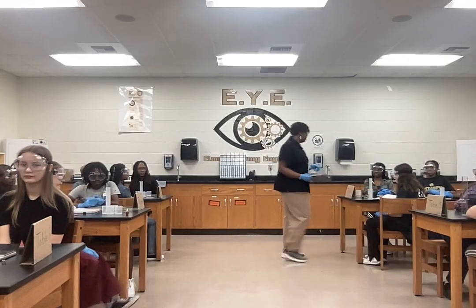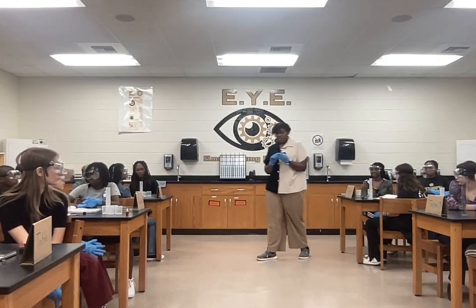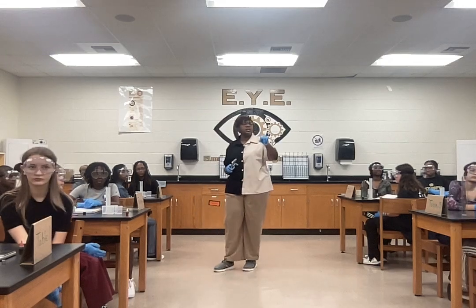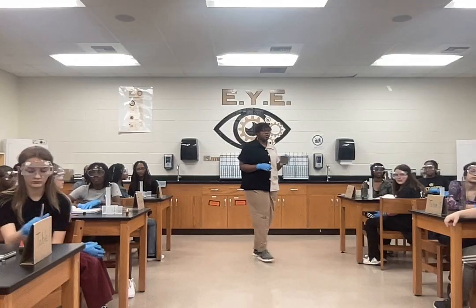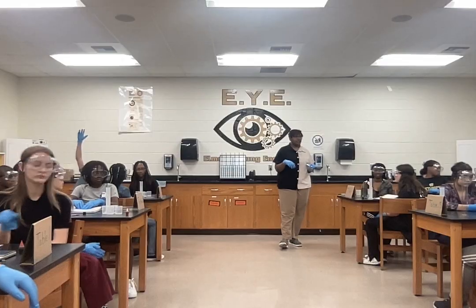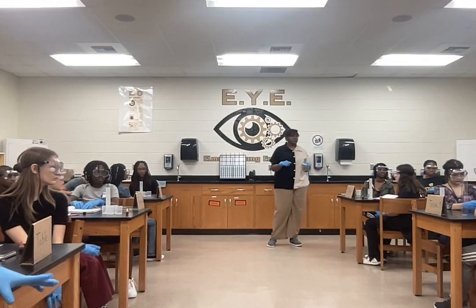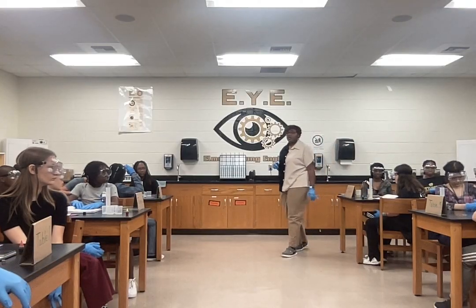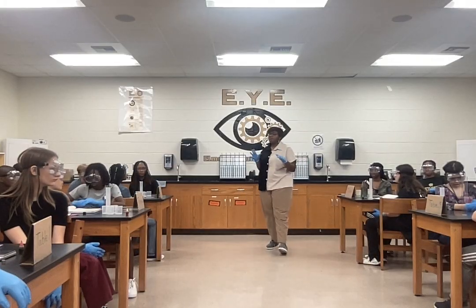After that, we're going to use our balances here to take the mass of the water and the graduated cylinder. Now, if you look at the board, you see the graduated cylinder is about 35 grams itself. So when we take the mass of that plus the water, what do we need to do if we want only the water? And raise your hand, don't shout out the answer. Yes? We need to subtract the weight of the graduated cylinder by the weight of the water. Good. He said we need to subtract the weight of the graduated cylinder from the weight of the water. And let's try to use the word mass, because remember there's a difference between mass and weight.